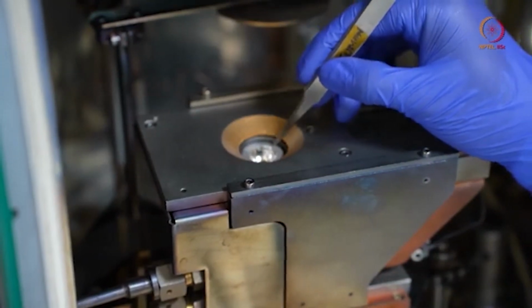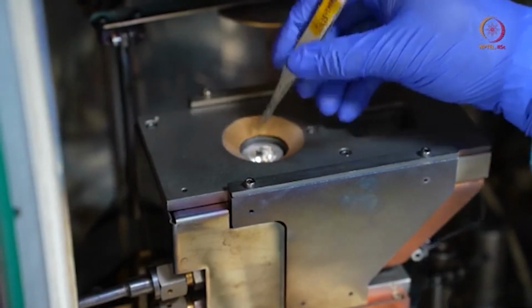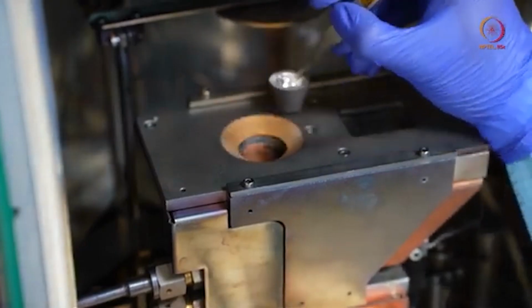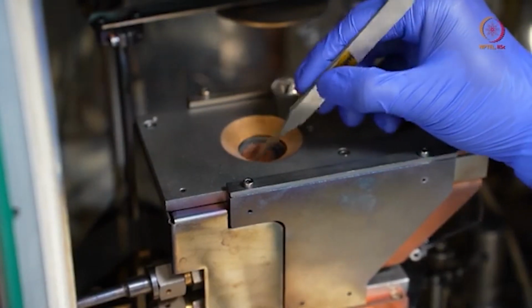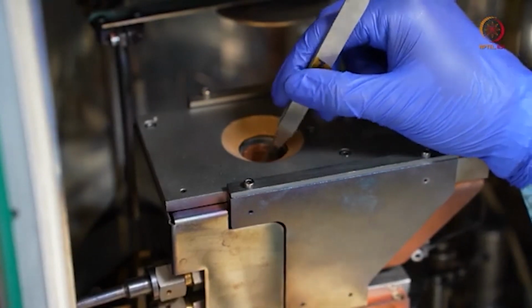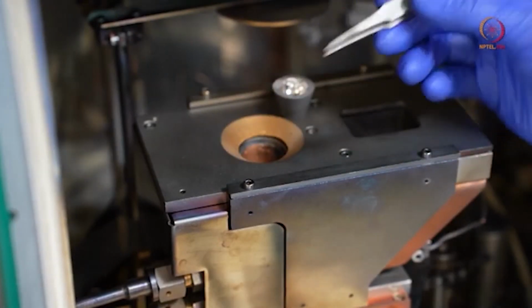Here titanium is loaded, you can see. How to take the crucibles out? You can take any tweezer like that and just slowly take it out. Here you can see that these are basically the holders for the crucible. This whole turret can rotate or move.